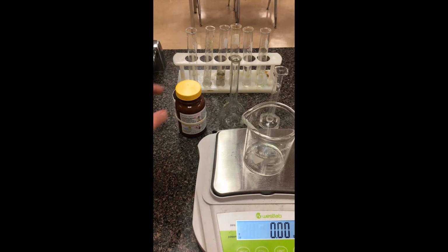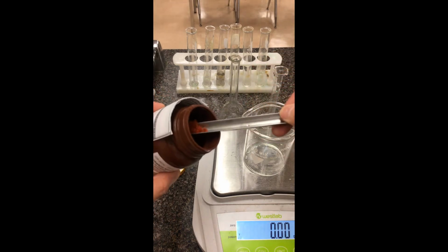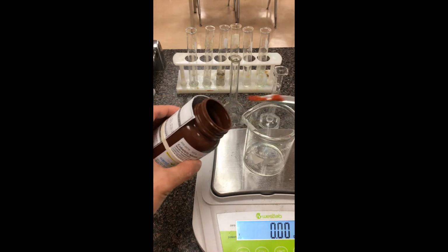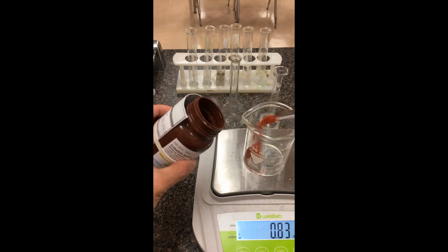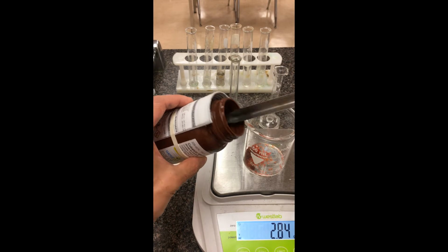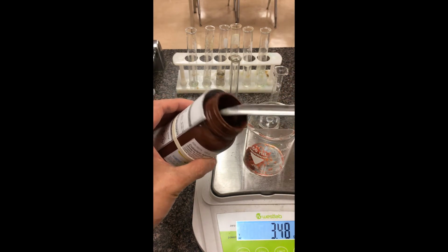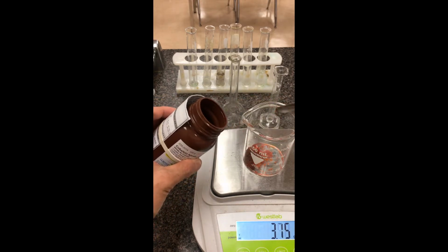We have a 0. My lab handout tells me to weigh out 4.66 grams. Of course, we want to get as close to 4.66 as we can. If we go a little bit over, it's not the end of the world. You would just record that mass down with any associated error, and then use that for your calculation. Always better to start off with less. If you need more, you can always go back for more of this chemical. If you happen to take too much, it's best practice not to put the chemical back into the stock container, just in case it contaminates the rest of the stock bottle.